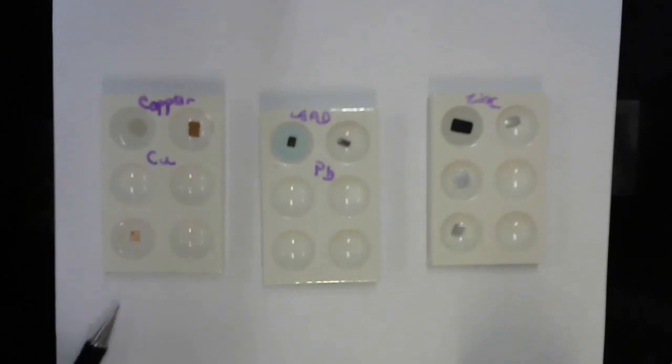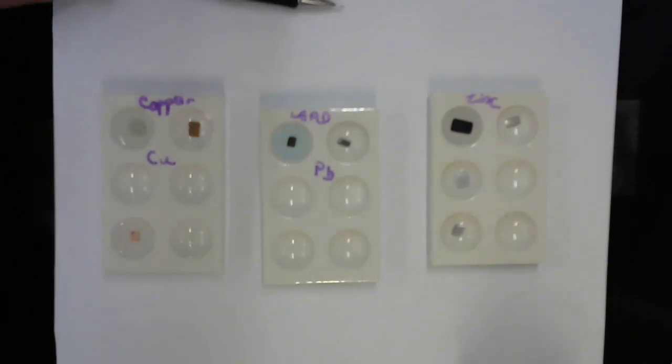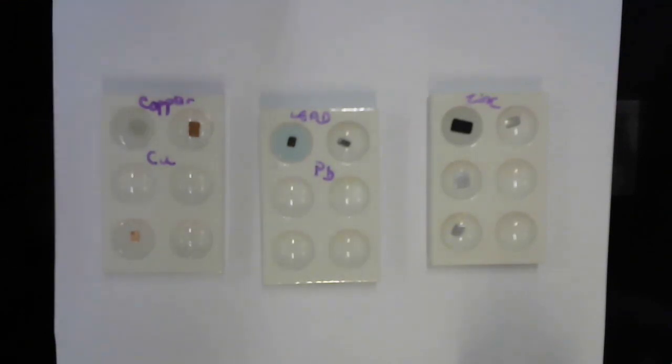Okay. Meanwhile, if you come back and look at this silver nitrate with the copper, these crystals are just gorgeous. They're beautiful, shiny silver crystals. It's going to be a shame to dispose of that. Okay, so that was reaction number 4, copper plus sulfuric acid down here. And I'm not seeing anything there at all.